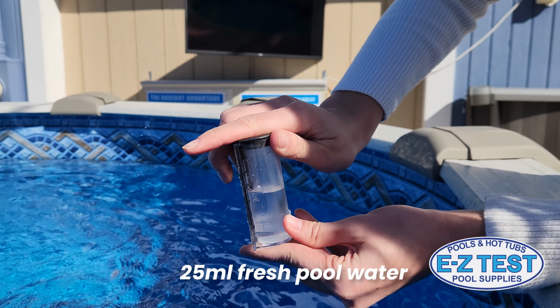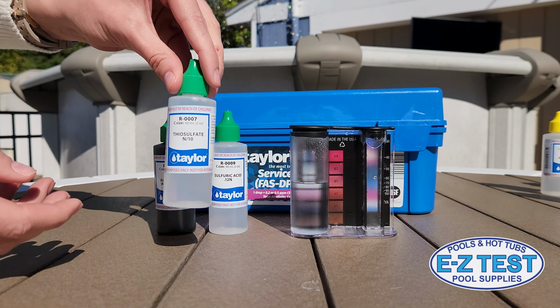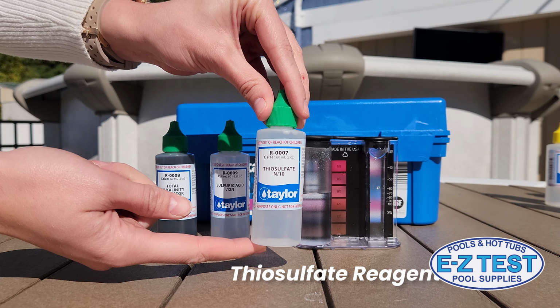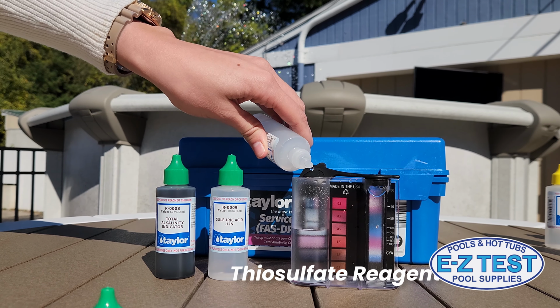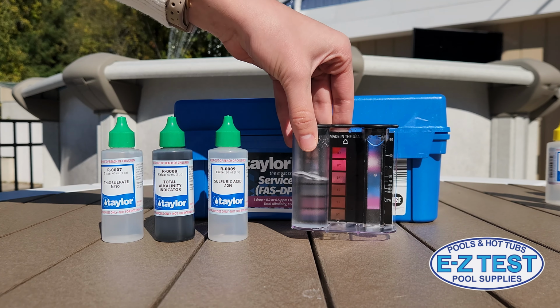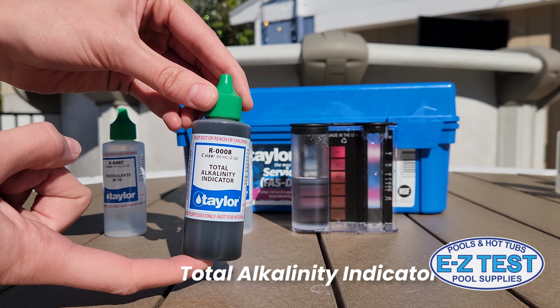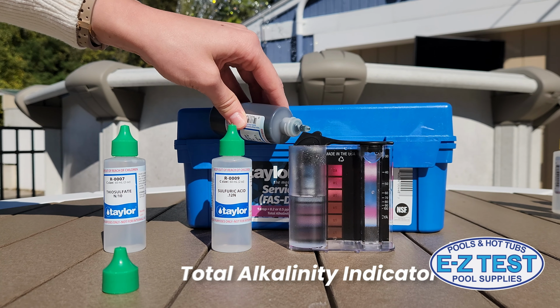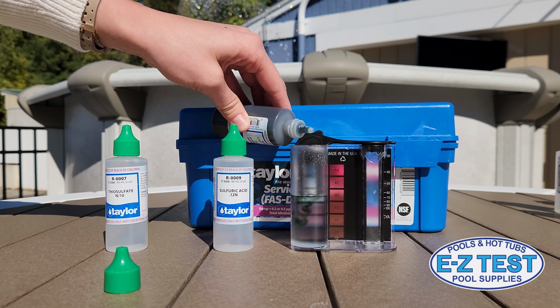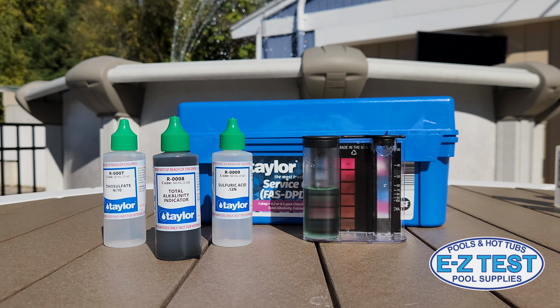Fill your test tube with 25 milliliters of fresh pool water. Add 2 drops of R0007 thiosulfate reagent and swirl to mix. Then add 5 drops of R0008 total alkalinity indicator and swirl again. The sample should turn green.